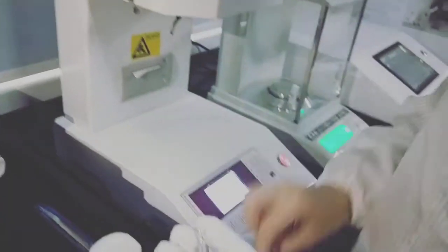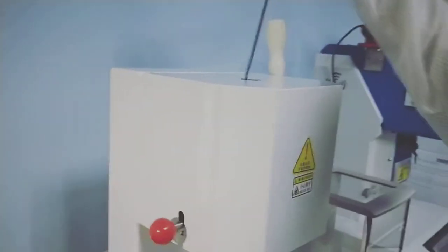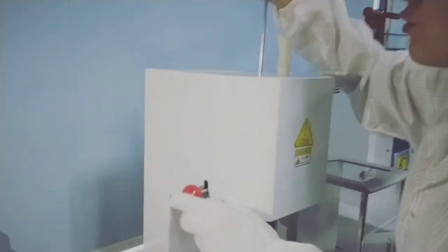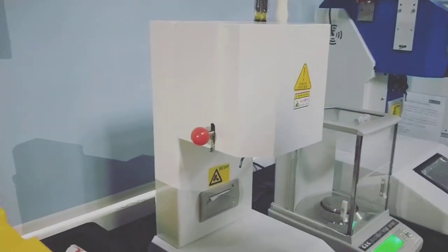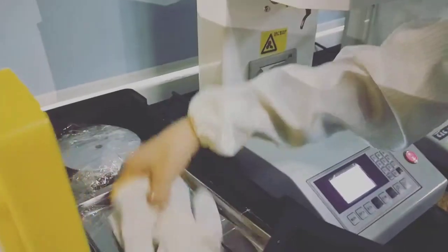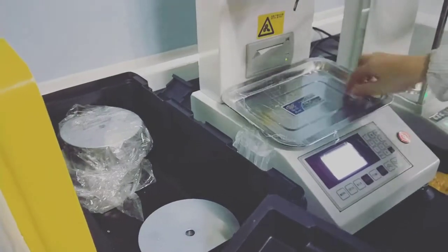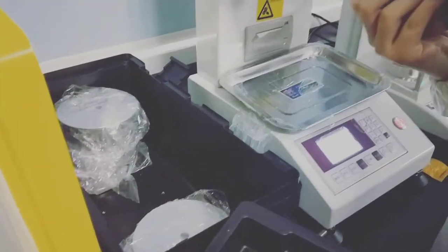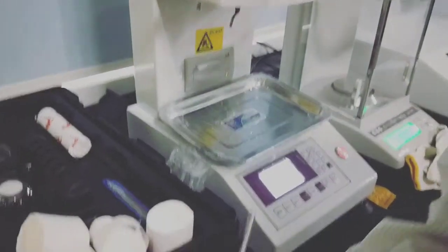Now we add the die into the sample. Press this button and put the die from this hole. And we can use this tool to make sure the die is to the bottom. And here are the sample plates. There are many pieces of weight. Here we need 2160. As this one already has 325, we add 1835.